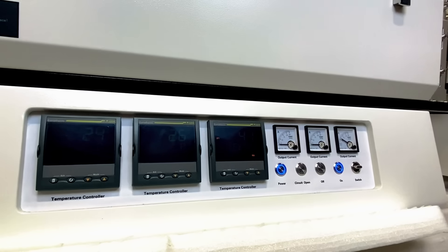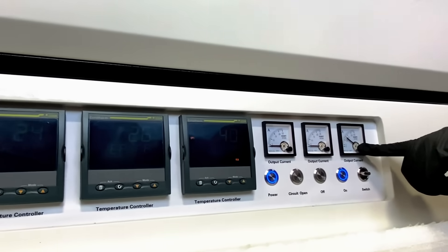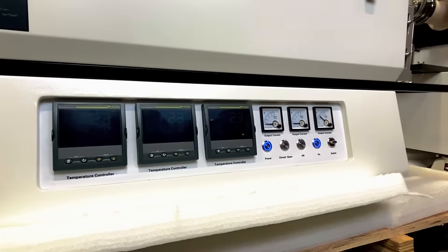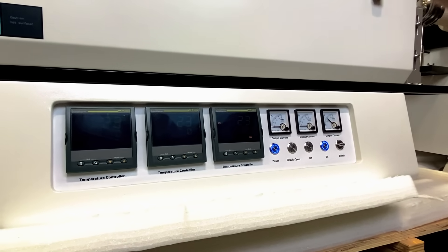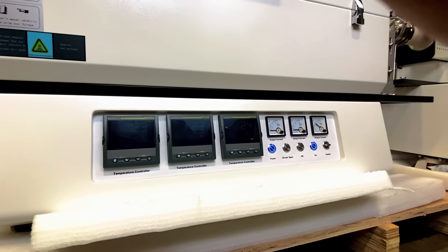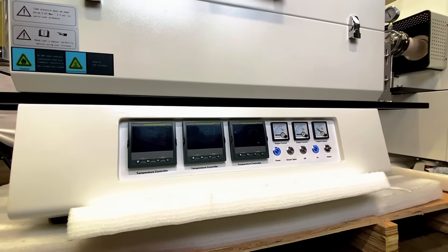As you can see, our amperage has gone up and our volts and amperage meters are showing the furnace is powered on. And you are ready to begin your heat treatment cycle with your Across International tube or chamber furnace.